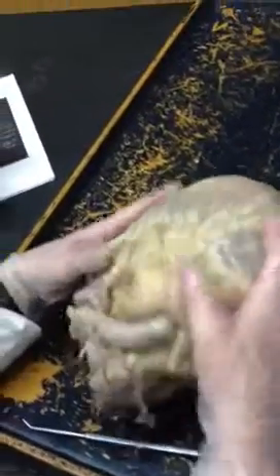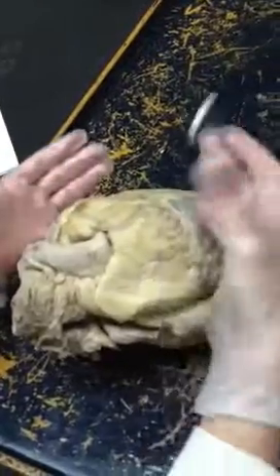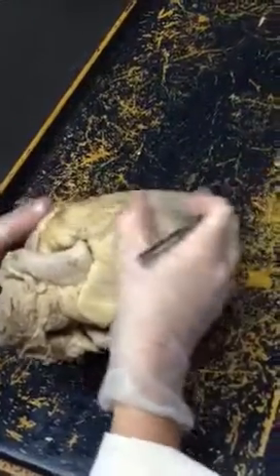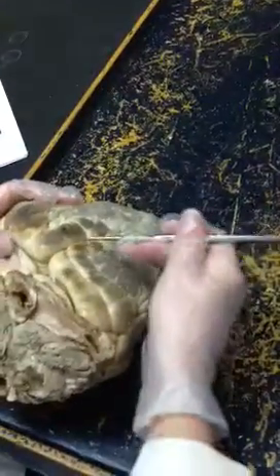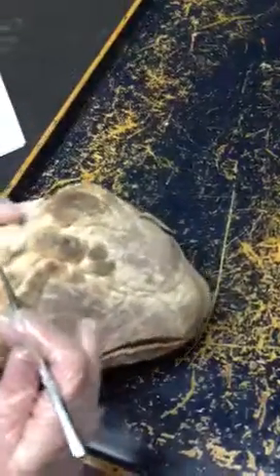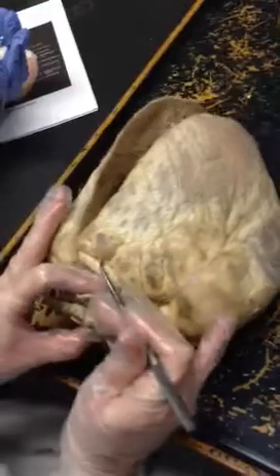So the other thing we have on the outside is the layer. If there was a pin stuck here and the card says 'layer,' we want epicardium — which is outside. If there's a card that says 'groove,' then we're looking for the ventricular sulcus or the coronary sulcus, which would be more around here — you can kind of see that little vessel right there.